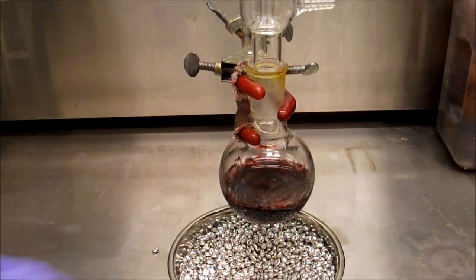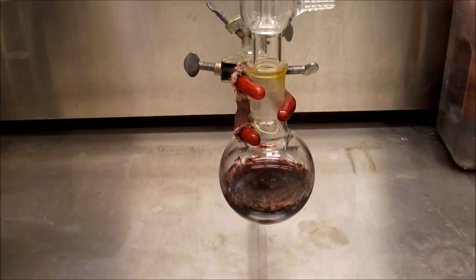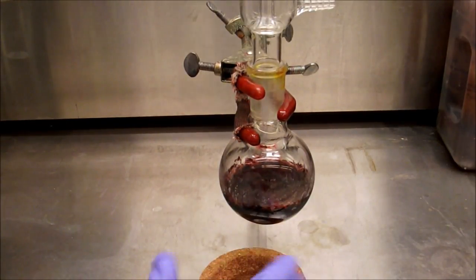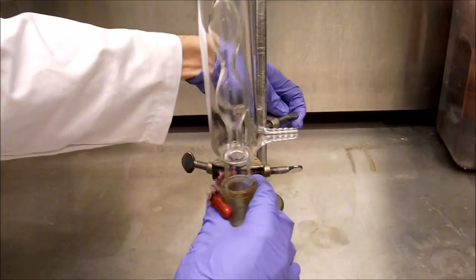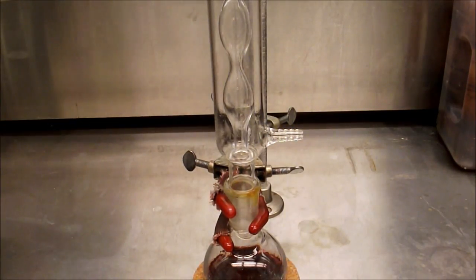After a day, the hotplate is removed and the flask is set on a cork ring. If you look closely, you can see small crystals of imidazole on the surface of the reaction mixture.